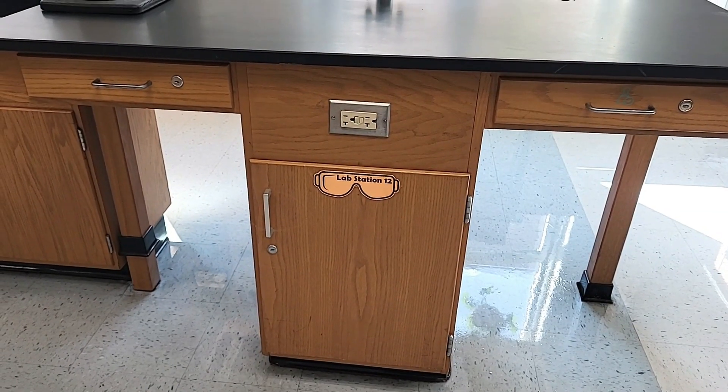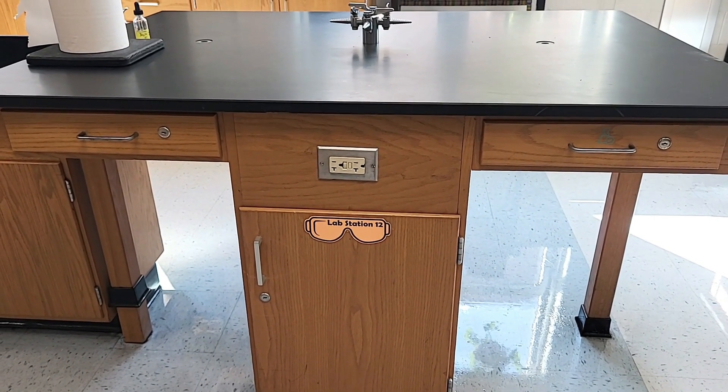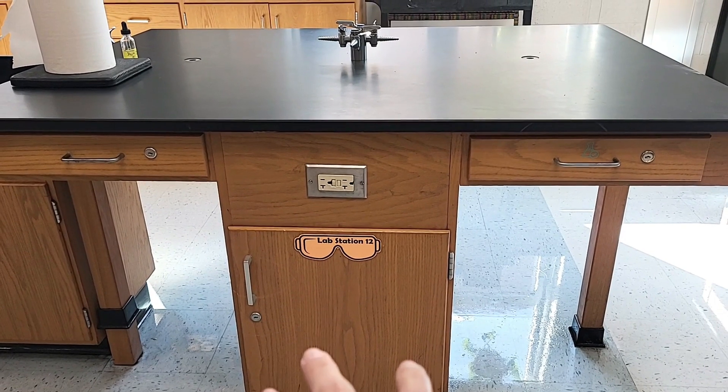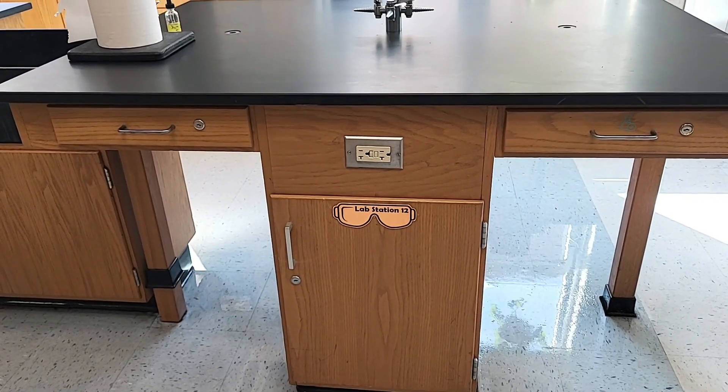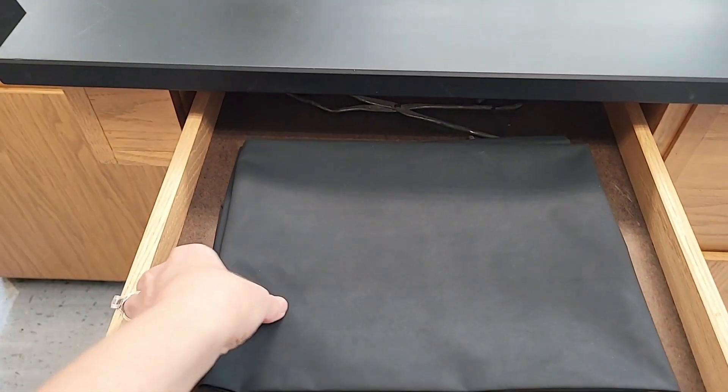My lab stations are definitely a lot different than they have been in my previous school. I do miss that setup because I had a lot more space for students to store their equipment. Every lab station consists of a set of drawers and a single cabinet. At my old school we actually had two drawers and a larger cabinet with two doors, so this is definitely a lot smaller.